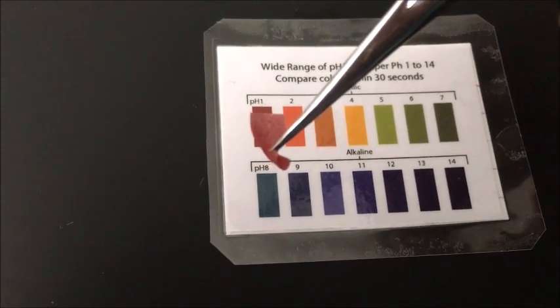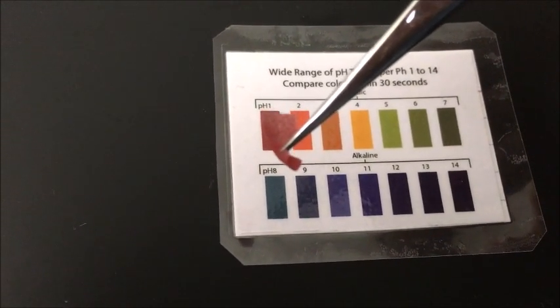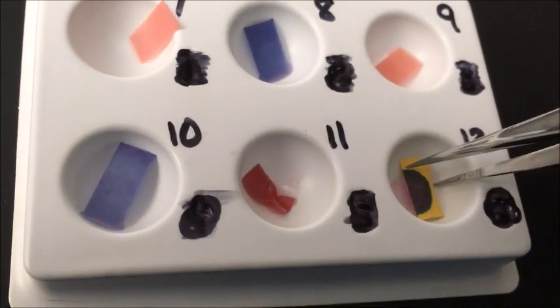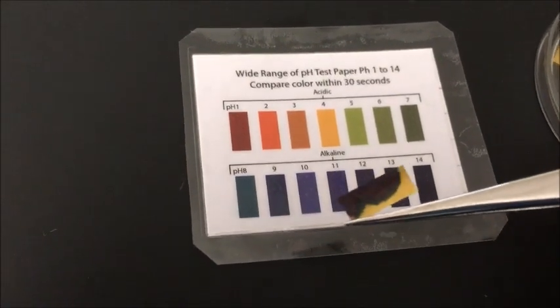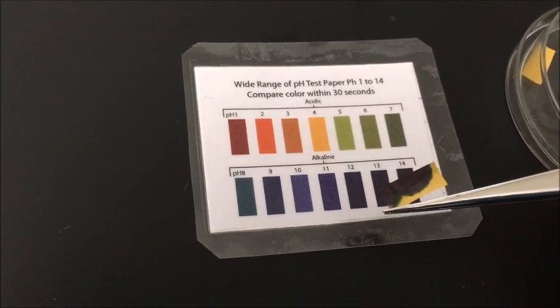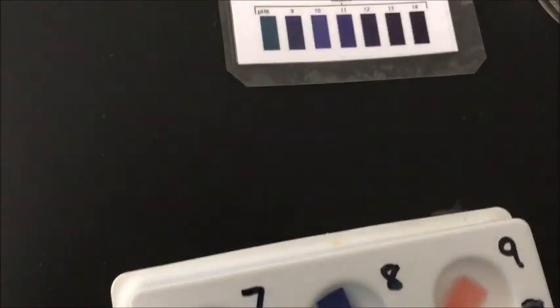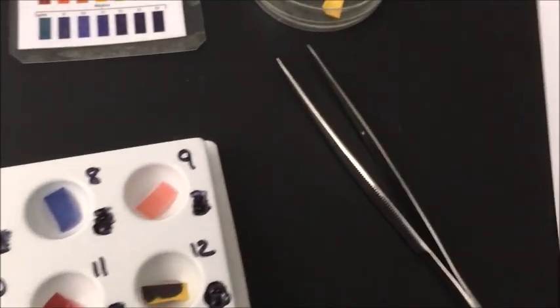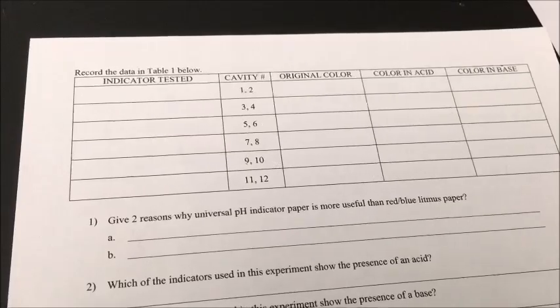You can see that universal litmus paper not only tells me if something is an acid or a base, but also gives the exact pH. Now here's the piece that was dipped in sodium hydroxide. Since I know it's a base, I read along the chart and it looks like it's in the 12 to 13 range on the pH scale. So the advantage of universal pH paper is that it tests acid vs. base and also gives the exact pH of the solution. Based on these observations I can fill in the last row of my lab handout.